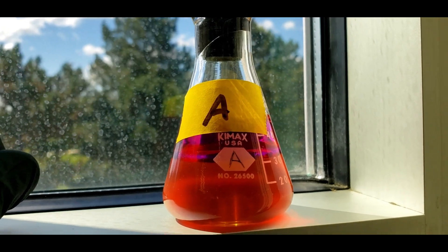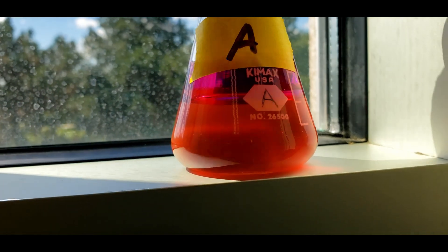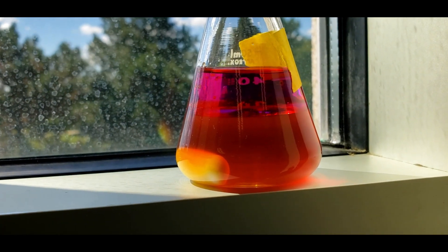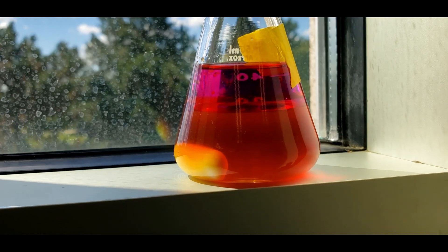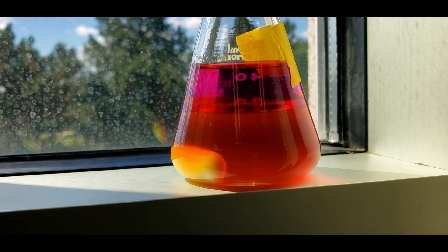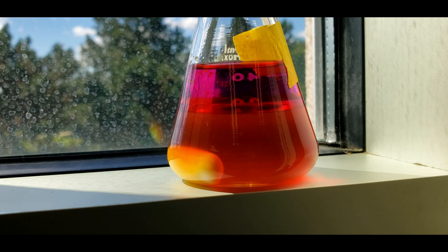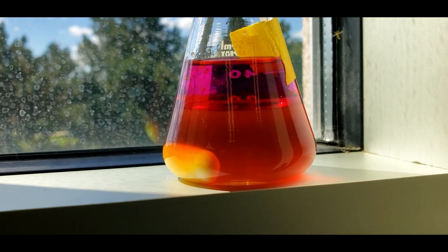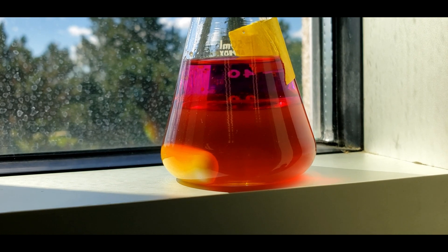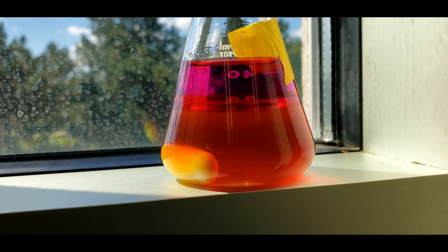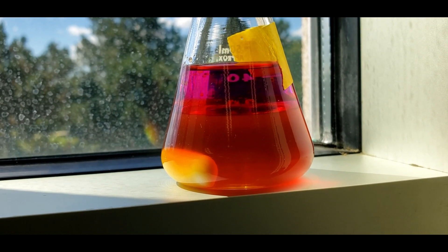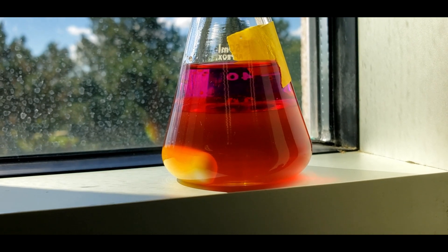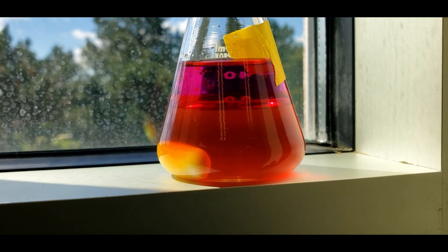Here's sample A. After mixing, I brought it over to the window ledge so you can see the layers better. The top layer is hexane. It contains iodine and only iodine. And then the bottom layer is the aqueous layer and that contains iodine, iodide, and then triiodide. And that equilibrium between those three will be what we're studying. But we're going to need the hexane layer for a little trick we do with the calculations. So we're going to be titrating both layers.